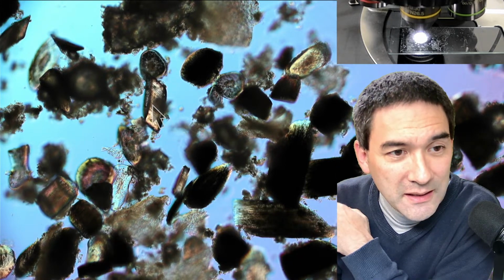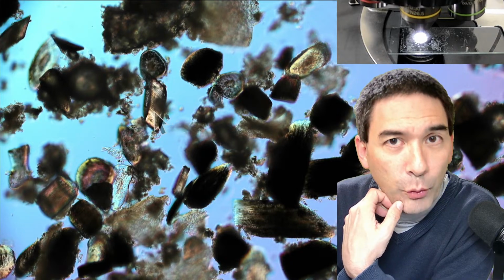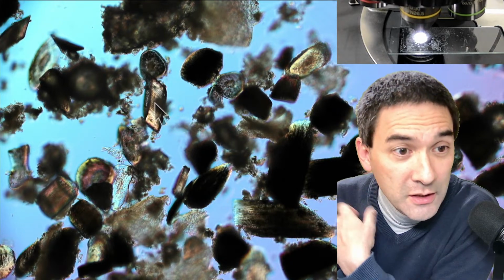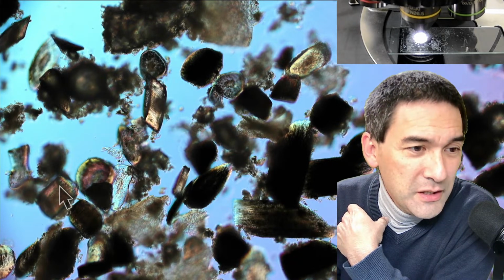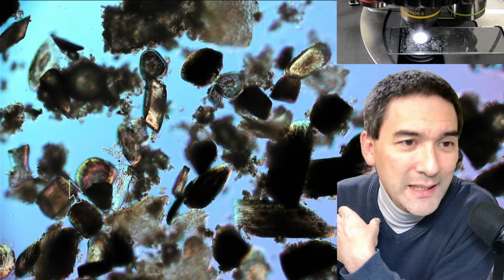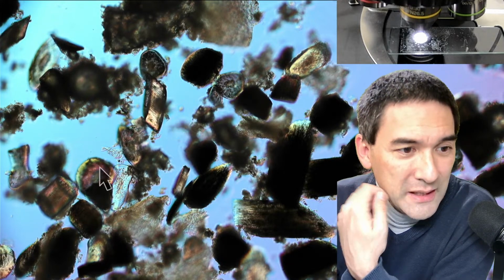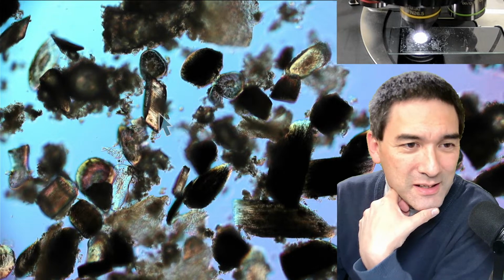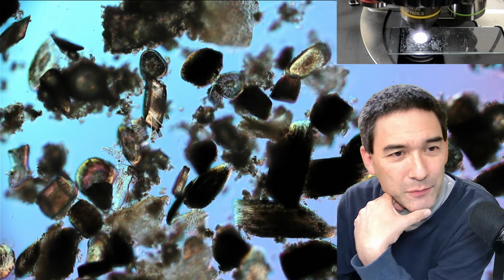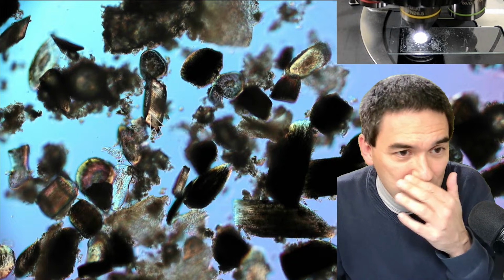So this is basically the amount that my beard has grown within 24 hours, because I shave myself every day, usually at the same time in the morning. Look over here, it's a little bit larger. Maybe I pressed a little bit harder or less hard, but who cares? As a reference, from here to over here is 24 hours. The question is now how much is this?